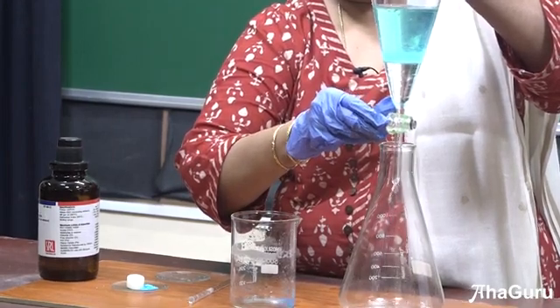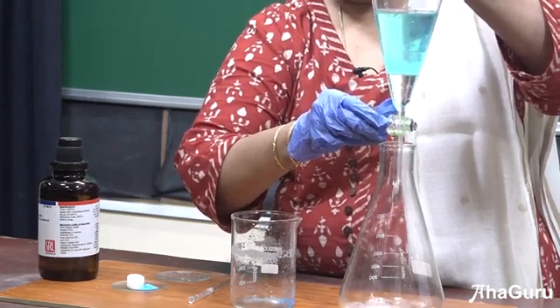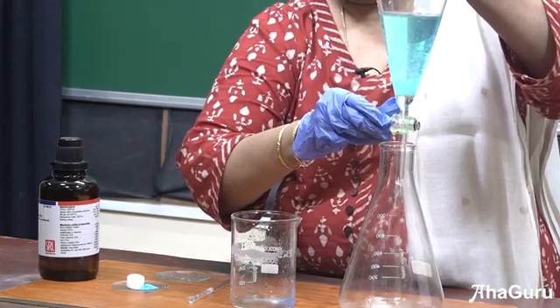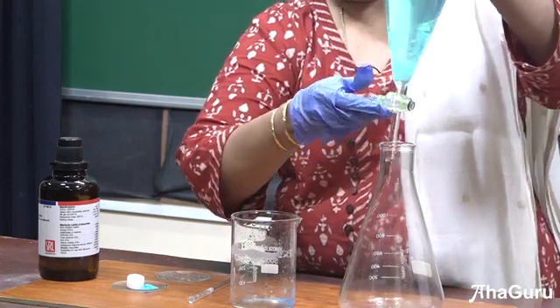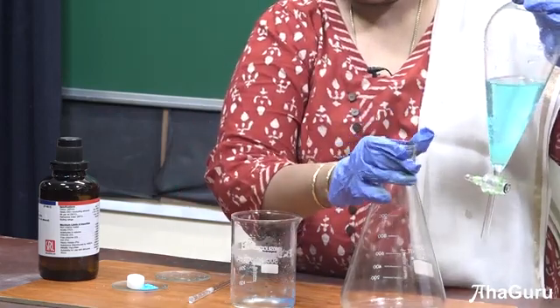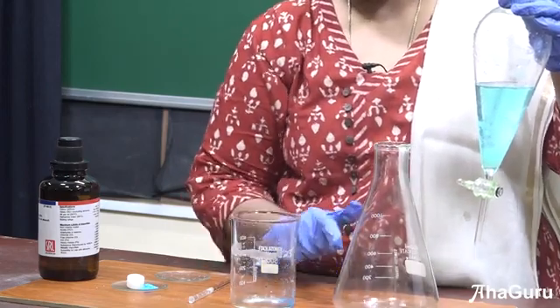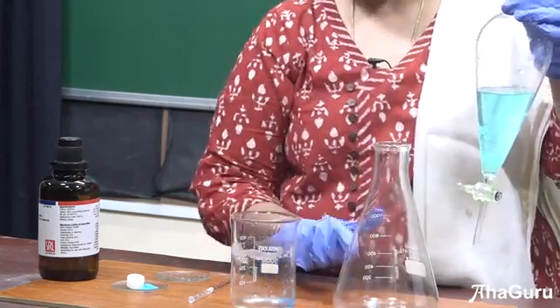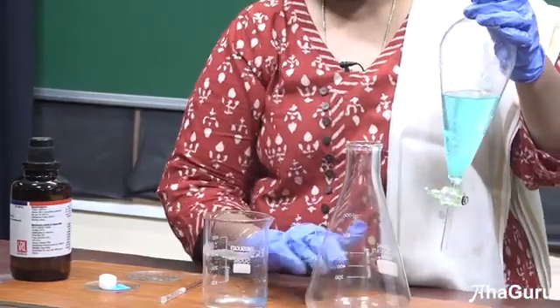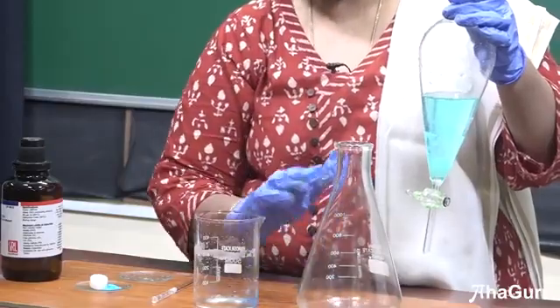We have to do it a little slowly so that the mixture doesn't get mixed up. You can see the blue layer and the colorless layer which is chloroform along with the organic compound. Now for this organic compound, you can just leave it for some time — the solvent will get evaporated and the solid, which is the naphthalene, will get separated out easily.